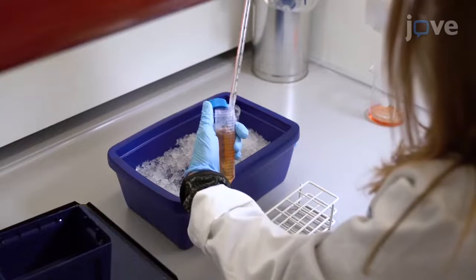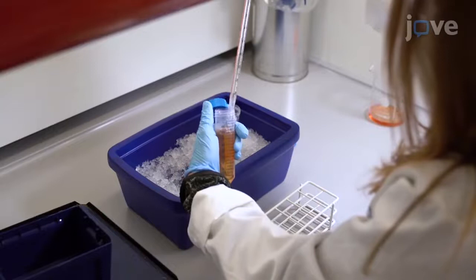Quench the reaction by adding 5 milliliters of freshly prepared 1 molar ice-cold glycine. Mix for 5 minutes with gentle rocking at room temperature.